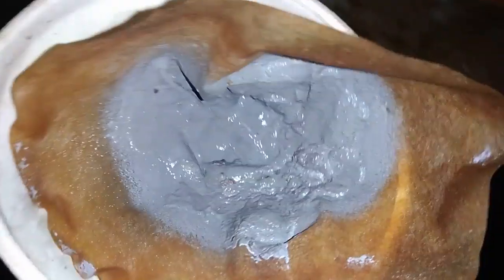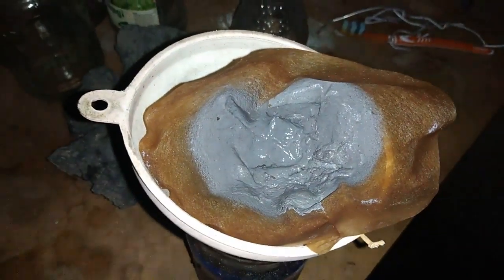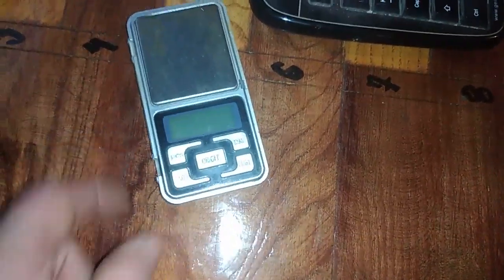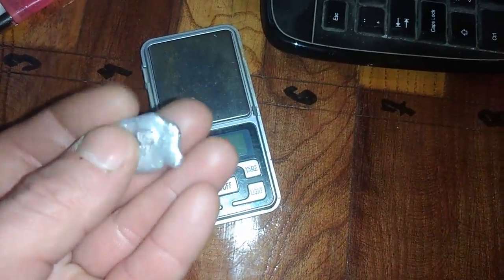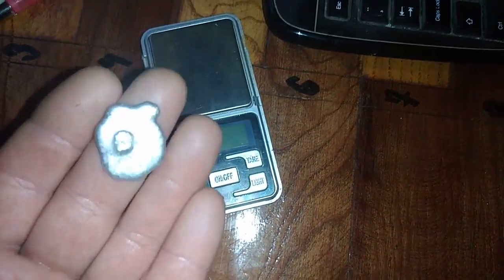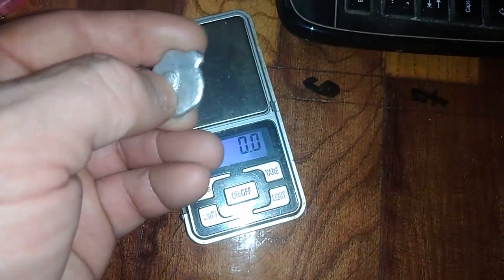And then I will start to melt. Okay guys, so after we finish our job, I melt our silver. And look at that — very, very nice. I got some pimple here, I don't know why, but very, very nice purity. Let's see what amount of silver we have.